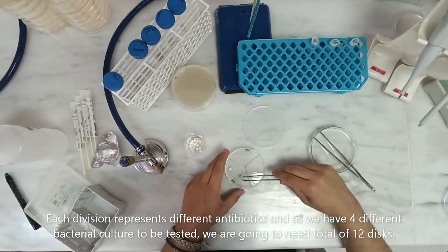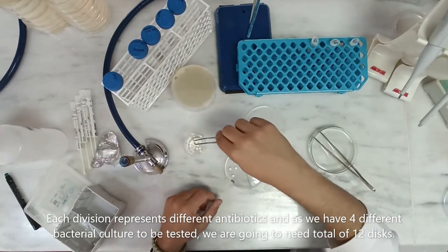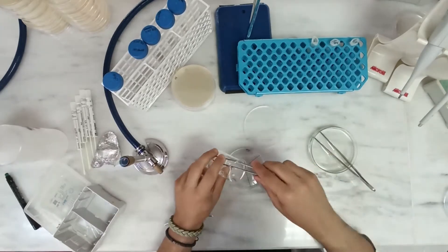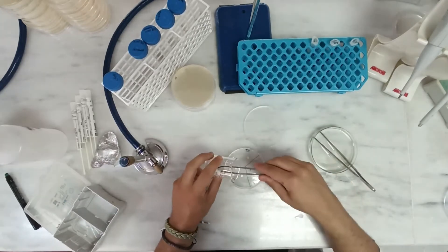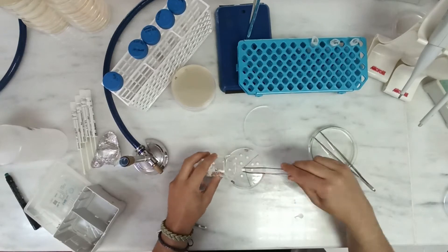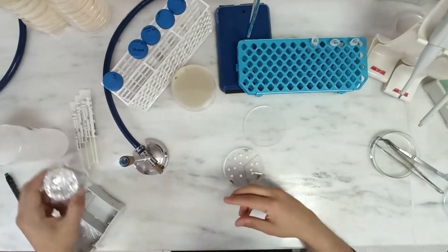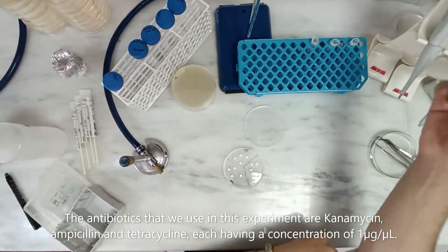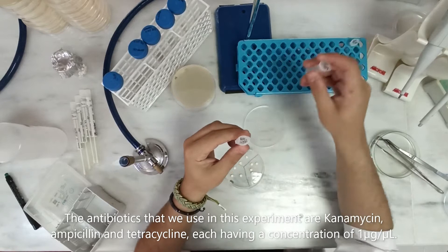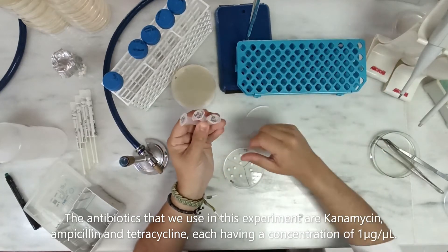Each division represents a different antibiotic, and as we have 4 different bacterial cultures to be tested, we are going to need a total of 12 discs. The antibiotics used in this experiment are kanamycin, ampicillin, and tetracycline, each having a concentration of 1 microgram per microliter.